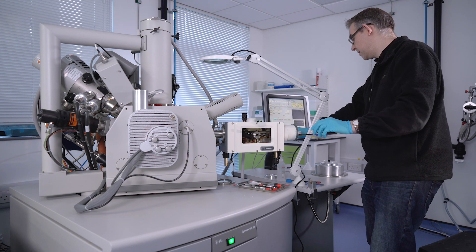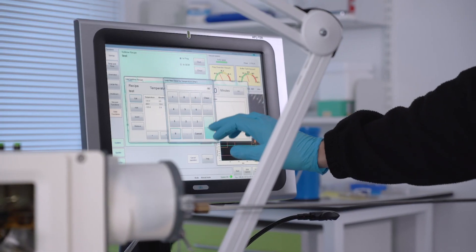We're now ready to sublime, fracture, or coat depending on what you want to do.